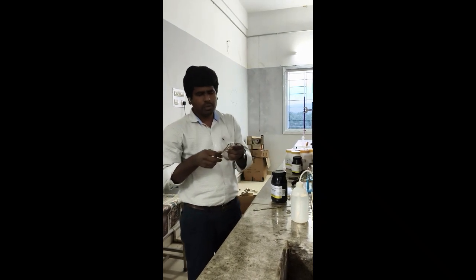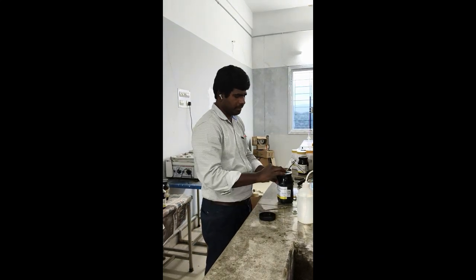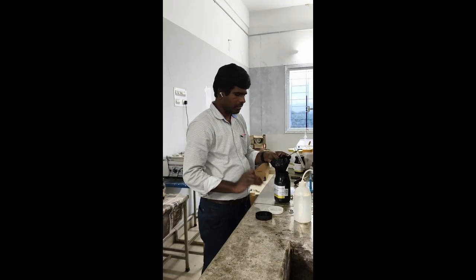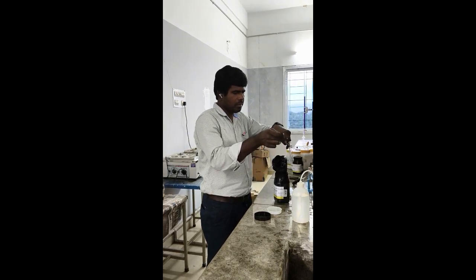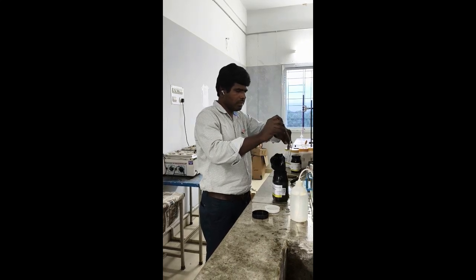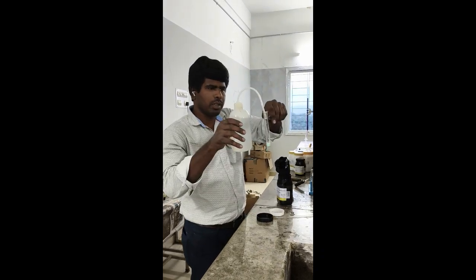So take another new test tube. So take ferrous sulfate, small amount, dissolve with water.